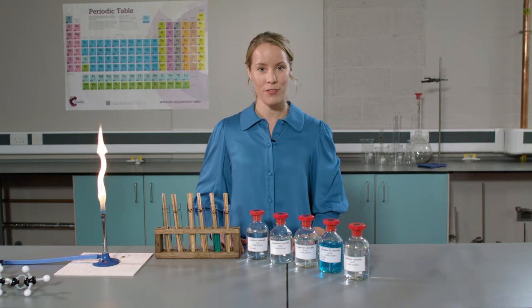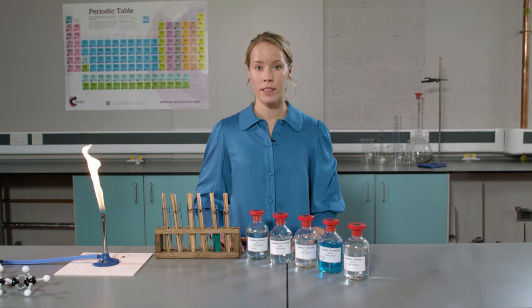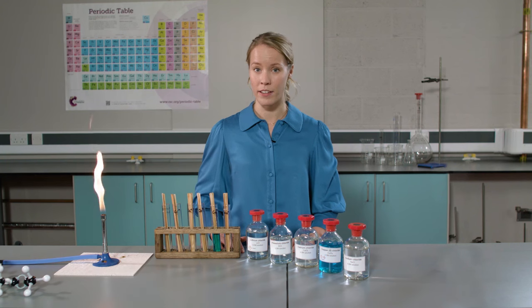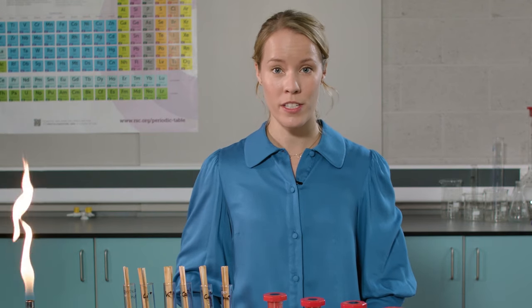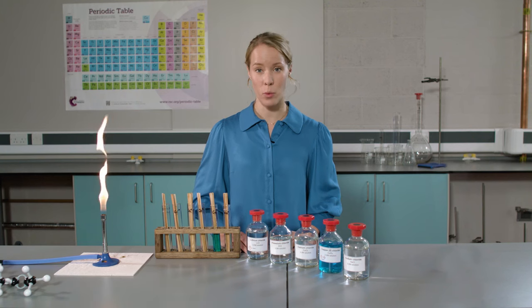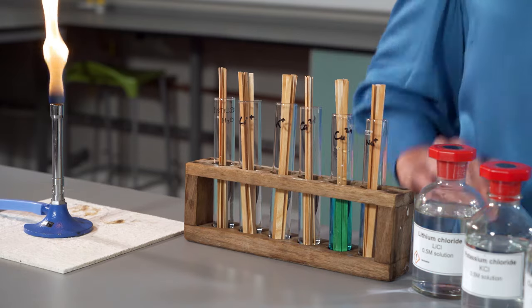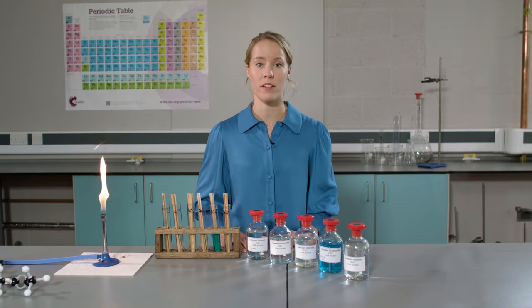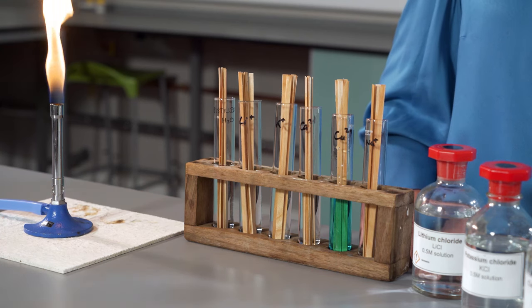So let's start with flame tests. Each metal ion shows a different flame color. So if we know the flame color of each metal ion, we can use that knowledge to identify an unknown ion. Today's practical is all about identifying these colors. We have the salt solutions containing the metal ions in labeled bottles. There are several different ways to carry out a flame test. Today I'm going to be using the wooden splint method, but you could use a nichrome wire. Both methods work well.